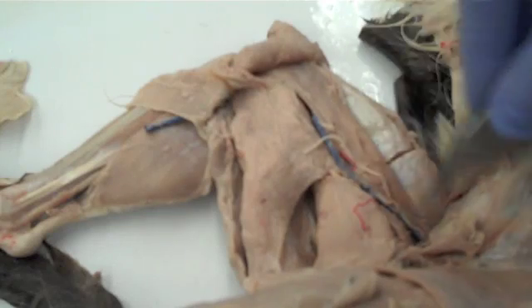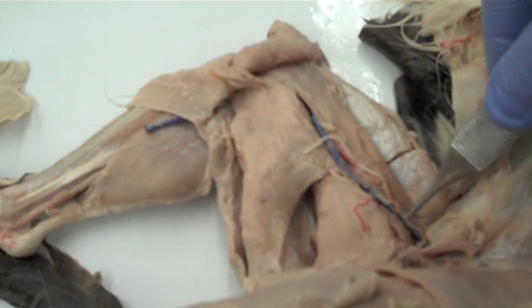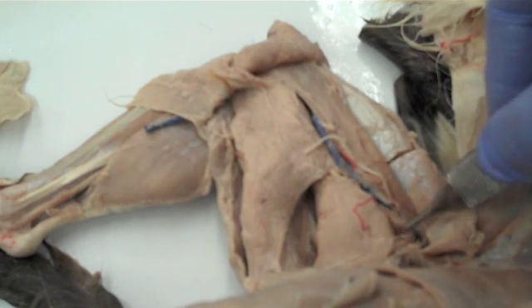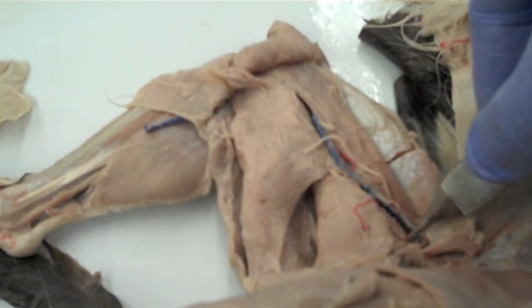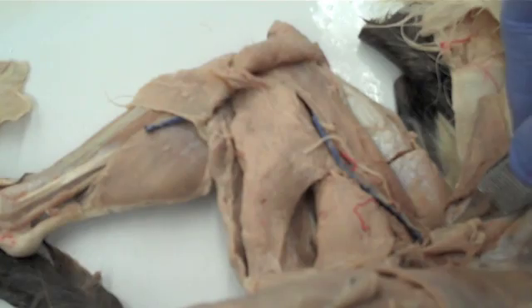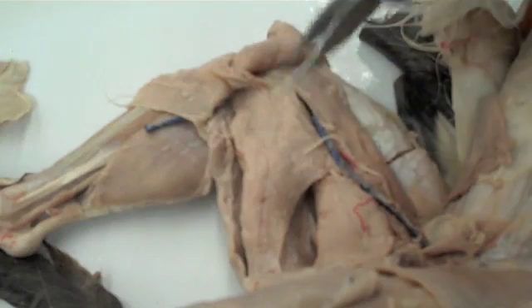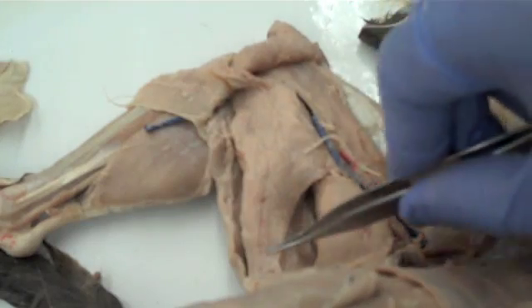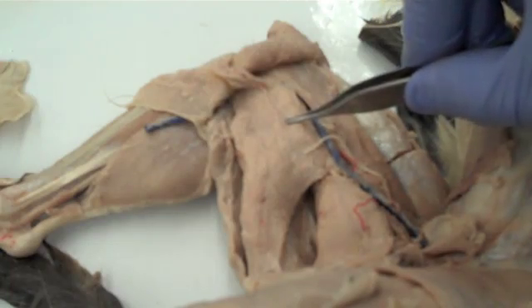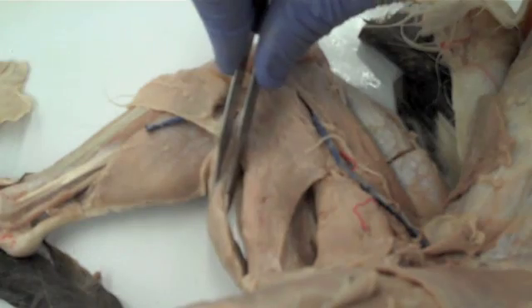The adductor group, visible here, includes the adductor femoris and the adductor longus, which is a thinner, darker colored muscle. The third muscle of this group, the pectineus, is not visible because it is deep. The third muscle group, the hamstring group, visible right here, is the semimembranosus, as it is the most medial of the three. Posterior to it is the semitendinosus, visible right here.